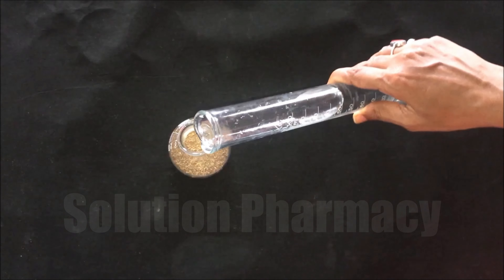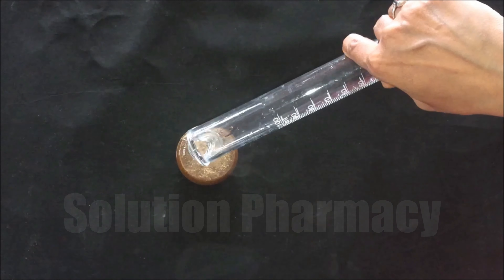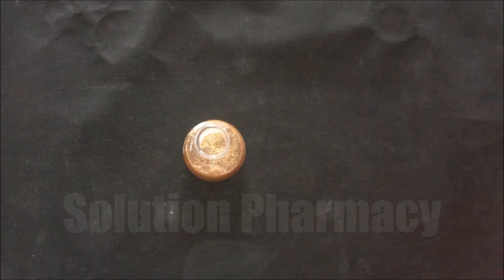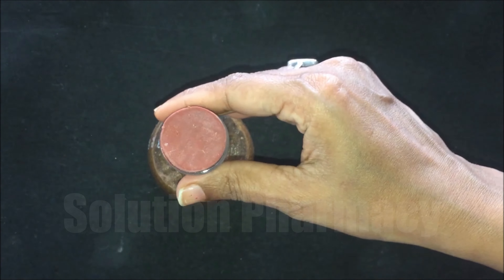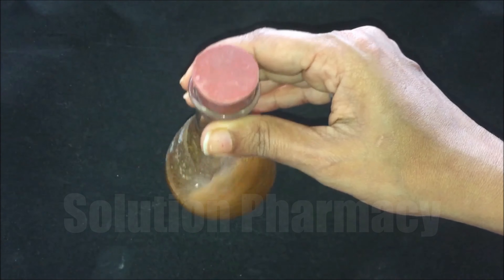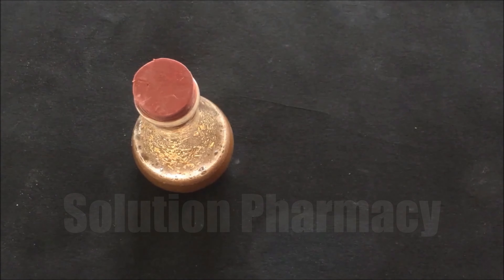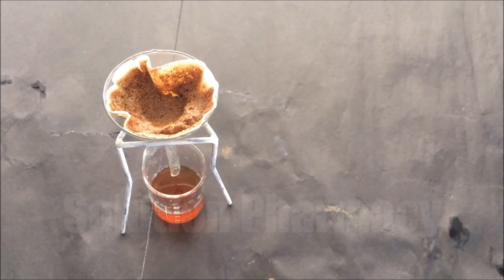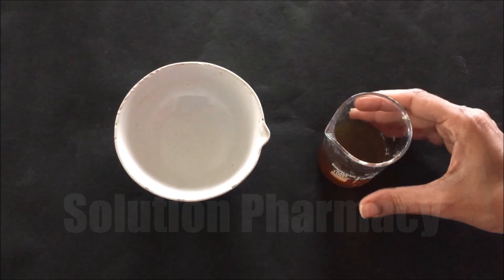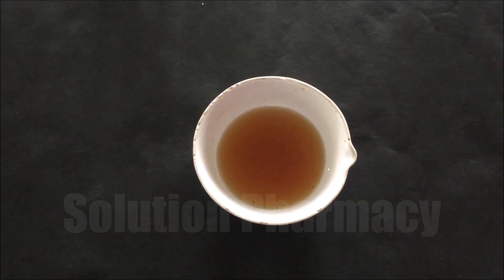We are going to perform the chemical identification test for alkaloids. We have taken about 5 grams of sample powder for the alkaloid test, then transferred sufficient quantity of ethanol — you can also use methanol in place of ethanol — for the preparation of the alcoholic extract. Cover the conical flask with a cork and shake properly. Keep the conical flask for about 30 minutes for extraction. After 30 minutes, filter the content through normal filter paper, discard the residue, and collect the ethanolic extract in a beaker.